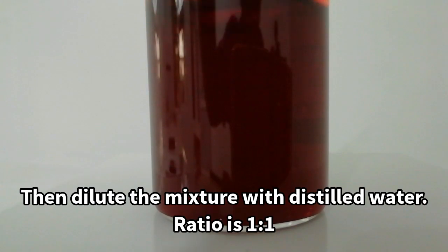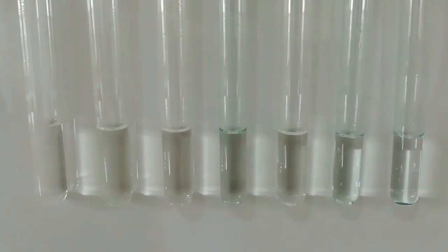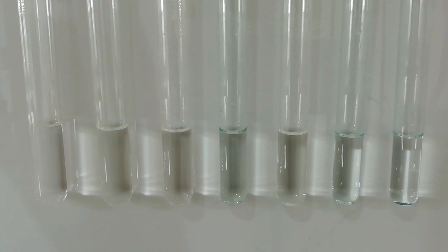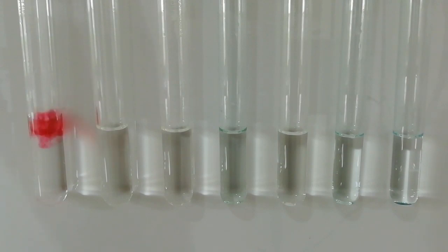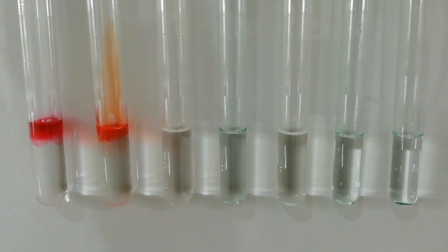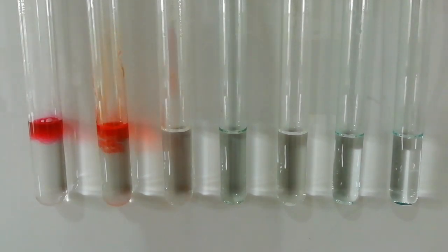Here is the concentrated pH solution. Next, the solution was diluted with distilled water. The ratio is 1 to 1. Now you can see the color series that I have prepared.